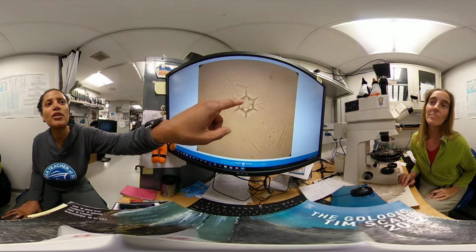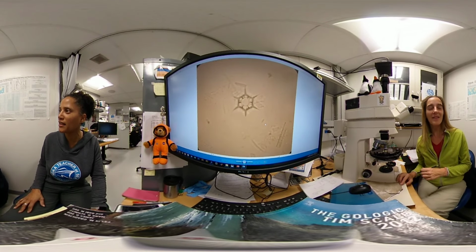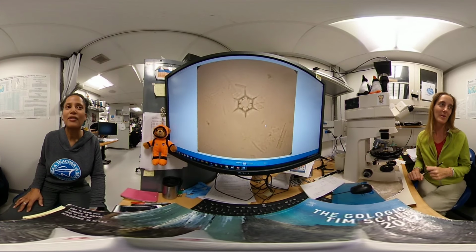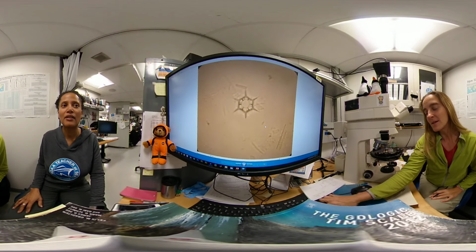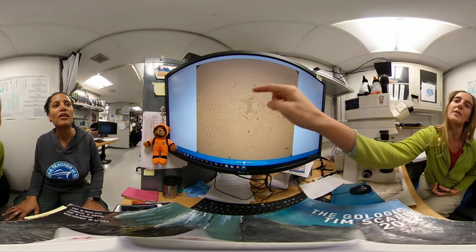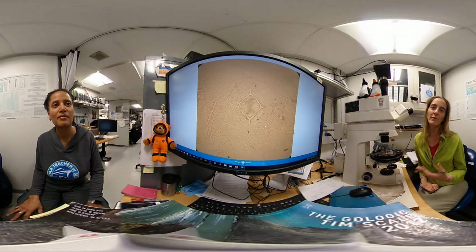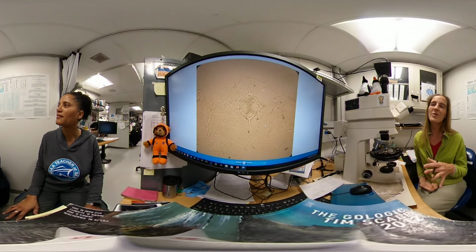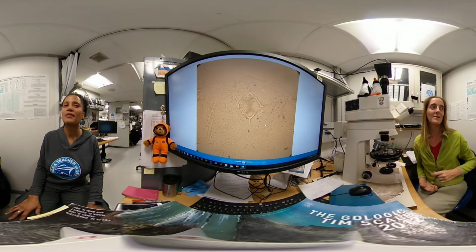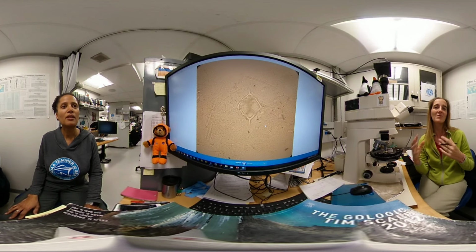Now, this has 1, 2, 3, 4, 5, 6 sides. Exactly. Do they always have that? This species is typically built in this shape, hexagonal. But there are other ones like this one, for example. Here we have the focus just on this part, and there is another portion here that is not visible. This one is more typical of warm waters. So we don't find it very abundant here, but if you go to the equatorial region, you will find mainly these other species. It's a very simple morphological concept, but it works well.